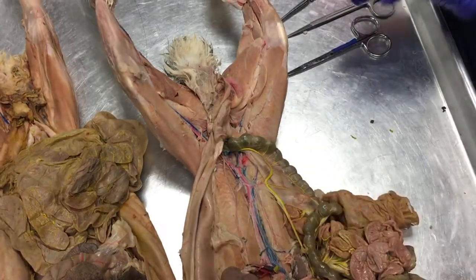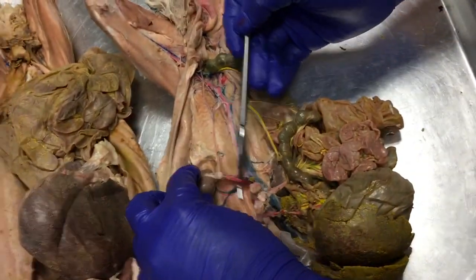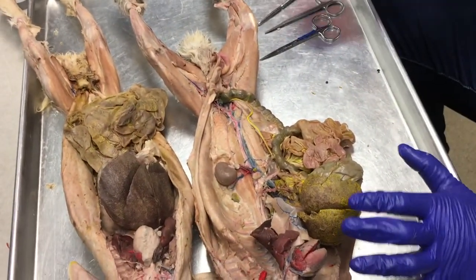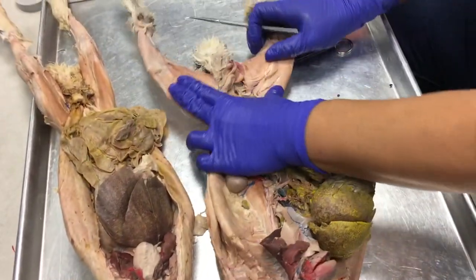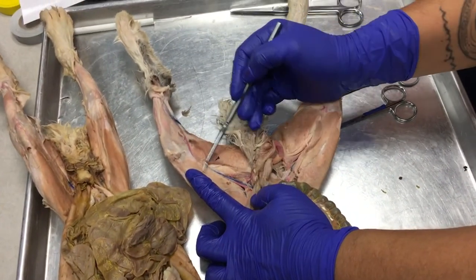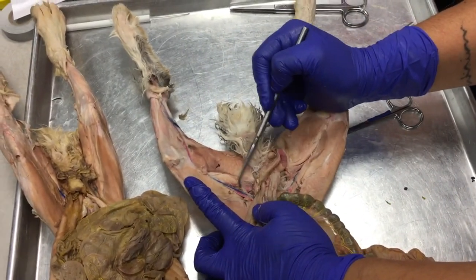All right? Can you show again the renal artery? Renal? Look at this big bad boy here. See? It's huge. What's cool about the veins is they're usually accompanied by the arteries. So if you know your veins, you should know your arteries. We're going to start in the posterior region here on the outside of the leg. This femoral vein here, the blue, is draining blood from the foot. This is a left femoral vein.